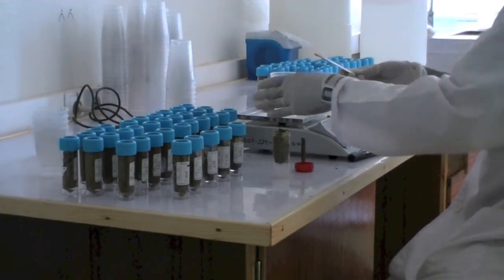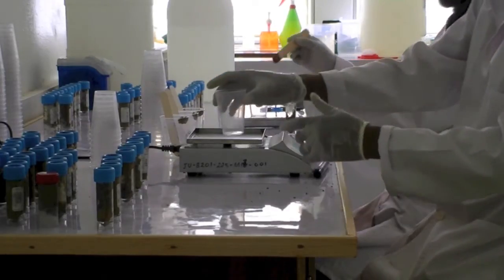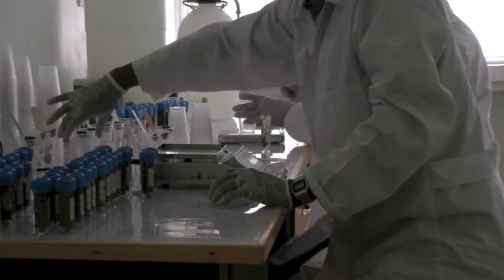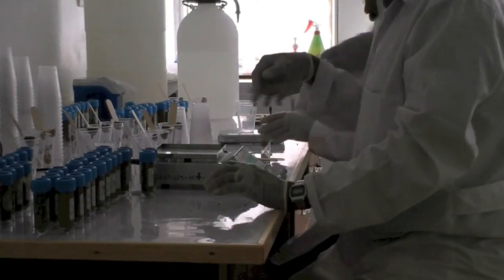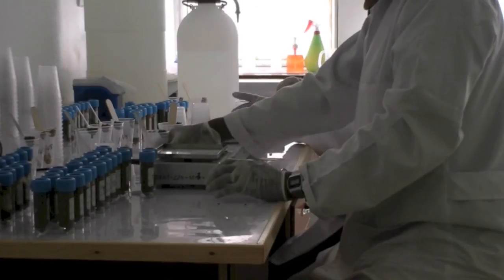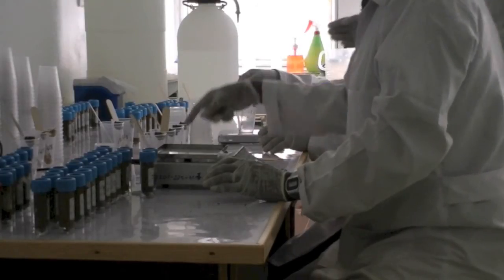This will allow weighing stool samples with two people and processing the McMaster in two parallel lines. To optimize the workflow, put all stool containers at both extremes of the table within reach of the two people weighing. Place all beakers filled with the right amount of stool and containing a spatula together in the middle of the table. This has three advantages: it is clear who needs to examine which sample; the same spatula is used exclusively for one sample across the entire process, avoiding contamination; and it creates a central point where beakers can be collected to bring to the next table.